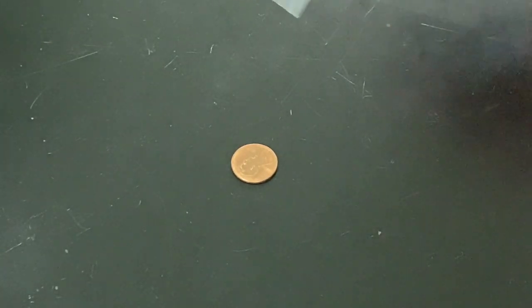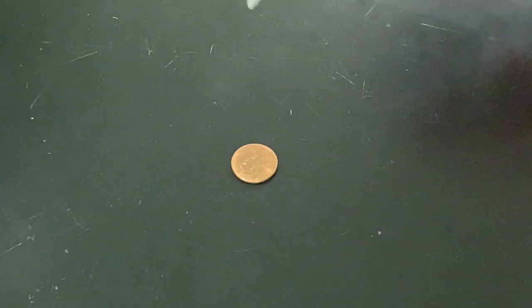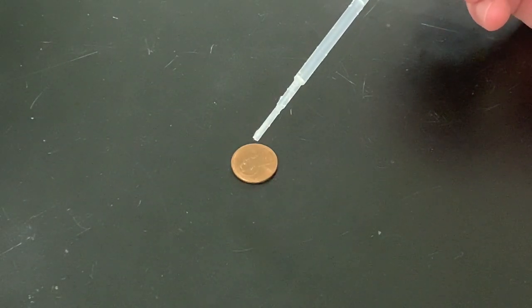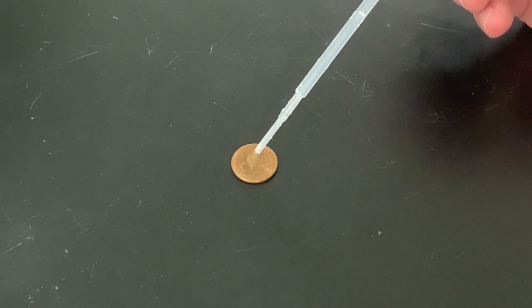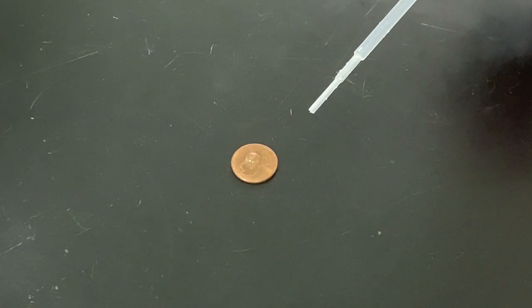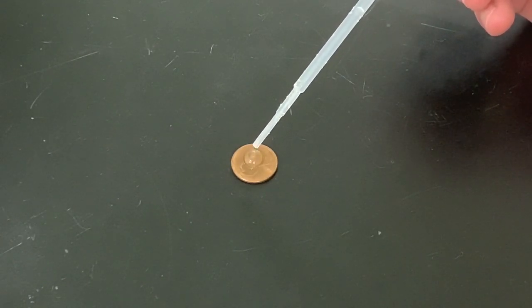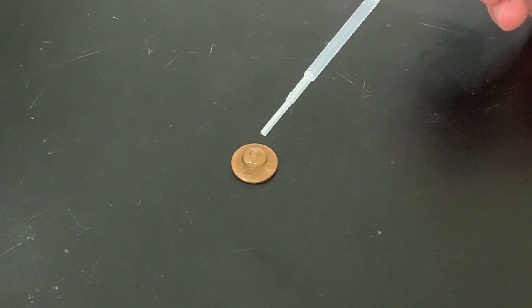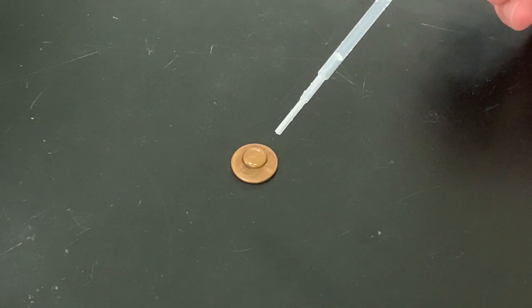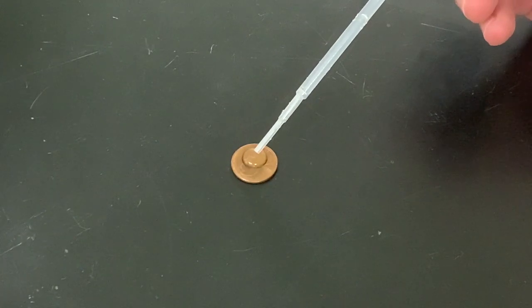So I'm going to just basically be adding water slowly as full droplets in order to see how much I can get on there. Okay, so we'll start off with our first drop, second, and as you notice, it's kind of bulging up in the center here. Third, fourth, fifth, sixth, seventh, eighth, and it looks like it's slowly starting to spread out. A nice little air bubble pop there, but it's starting to slowly spread out and it wants to stay together.